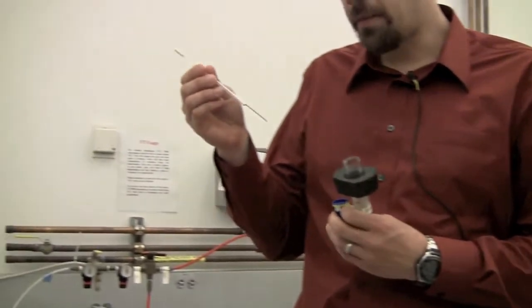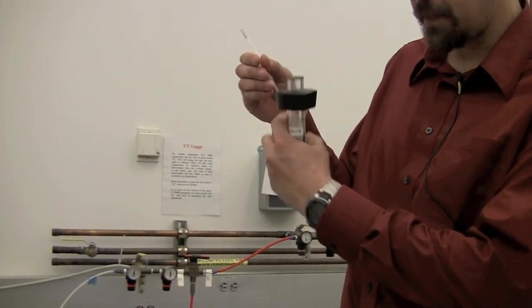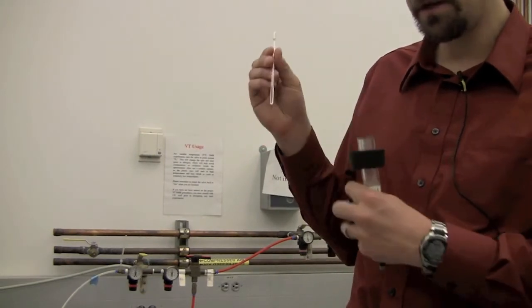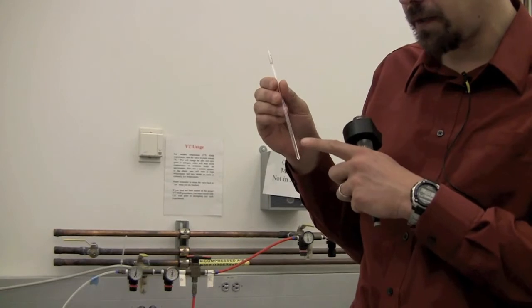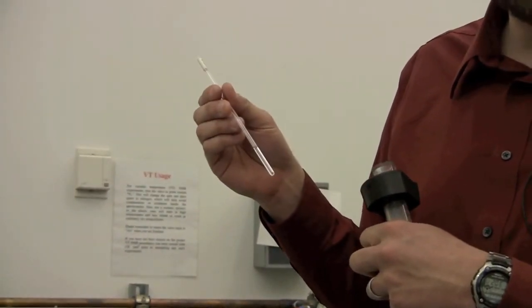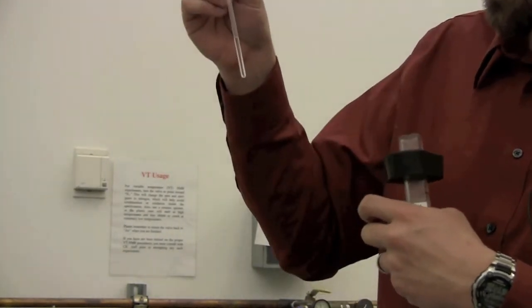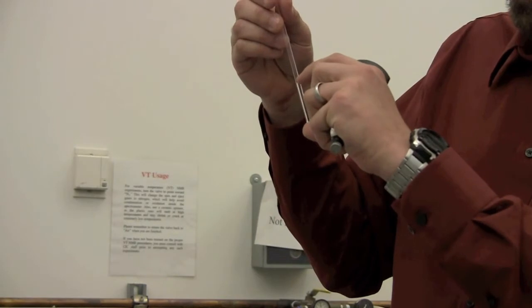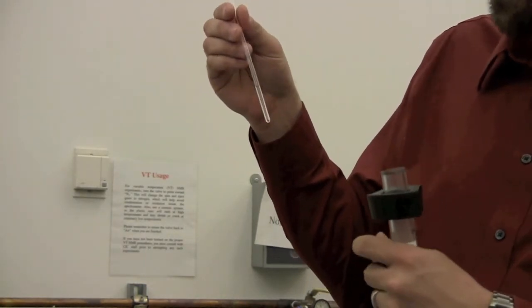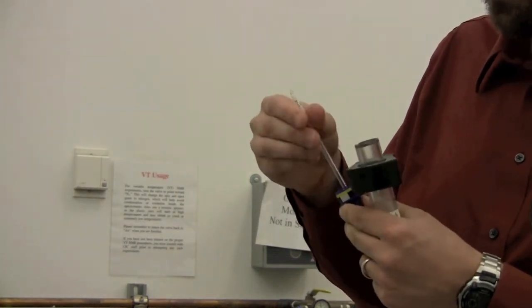You should know how to properly prepare your sample. It needs to be a reasonable height and in a good NMR tube. If the sample is too short, or if the tube is bad, or if there is debris in your sample, all of these things will cause poor resolution in your sample, and you'll get bad data. In this case, a reasonable height is typically 500 to 600 microliters. 600 is probably a good rule of thumb to use.